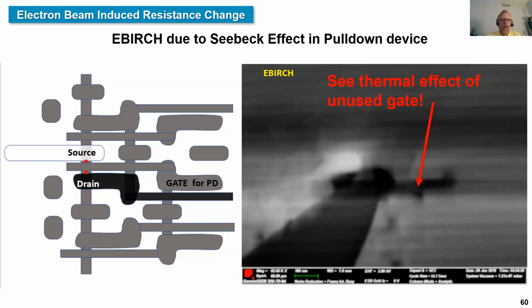In EBIRCH, we can actually look at a particular device when it's turned on. This is the on current of a pull-down device examined in EBIRCH. And we can actually see both the contacts and even a thermal effect of an unused gate. That's EBIRCH.